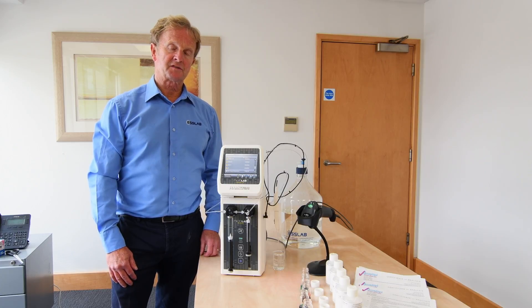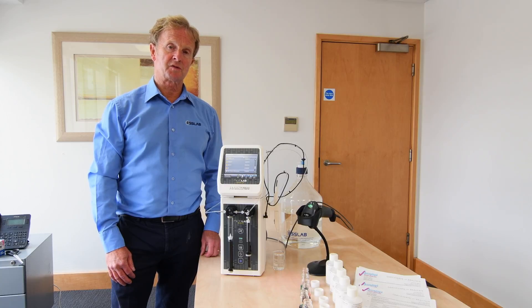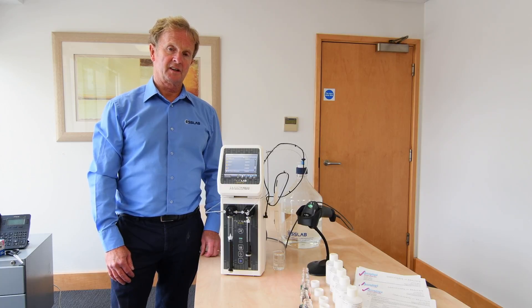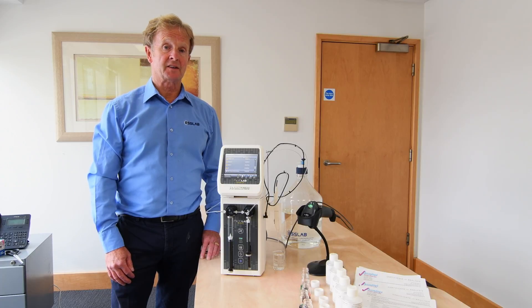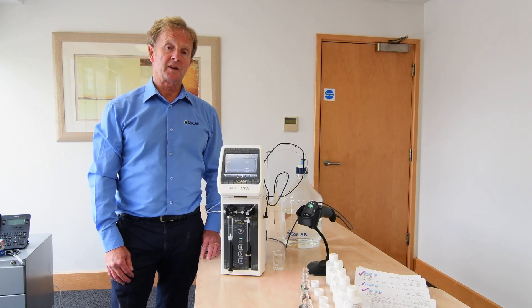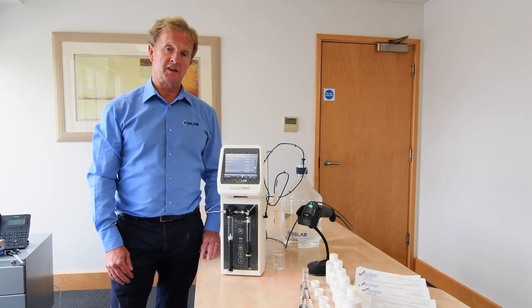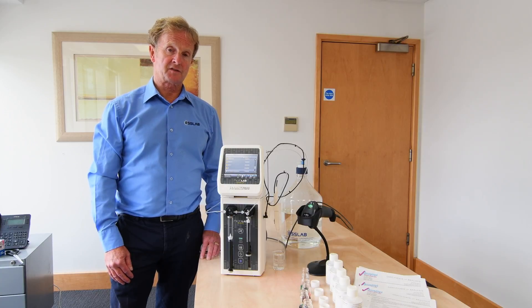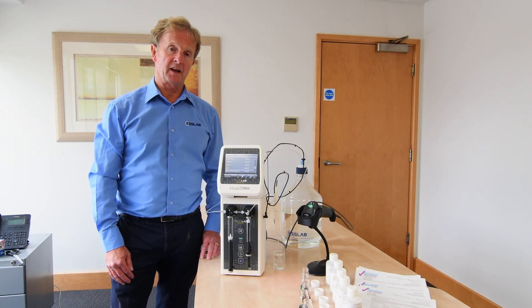Hamilton have developed a series of applications which includes a multi-sample addition. This is particularly useful when preparing standards to calibrate instrumentation or tuning solutions when we have a series of standards as a combination mix.